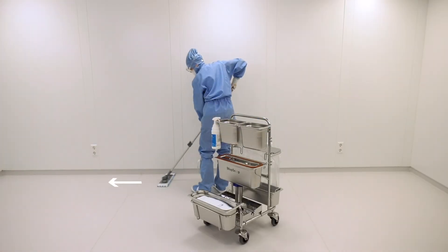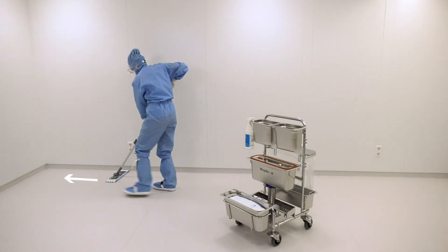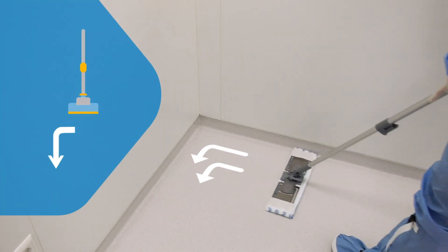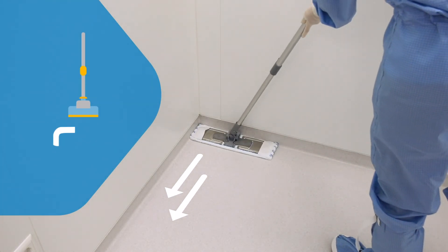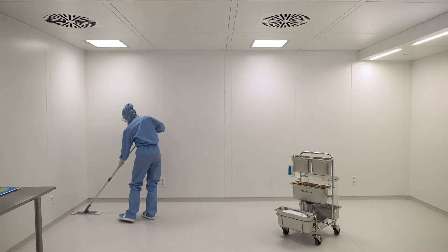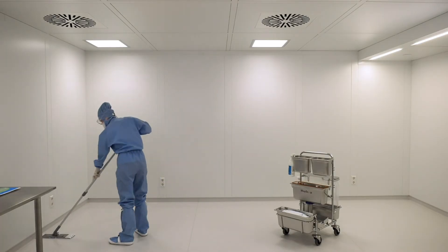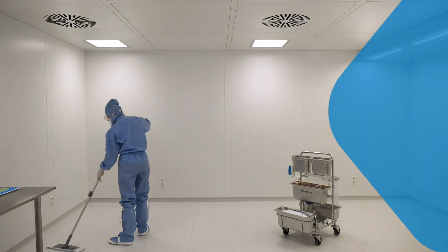Start your disinfection process by wiping along the edges of the floor. Make sure you use the correct technique for wiping out corners. If you have any obstacles in your clean room, make sure to wipe the floor under and around them. Wipe the empty floor area after you've cleaned the edges.